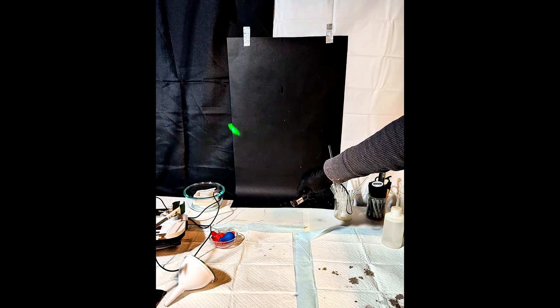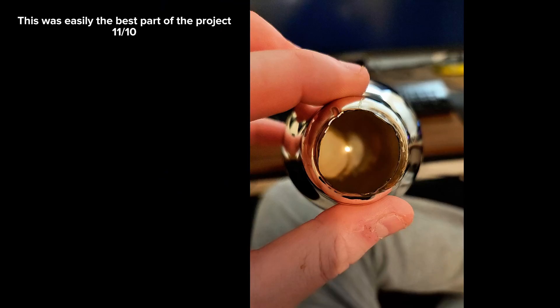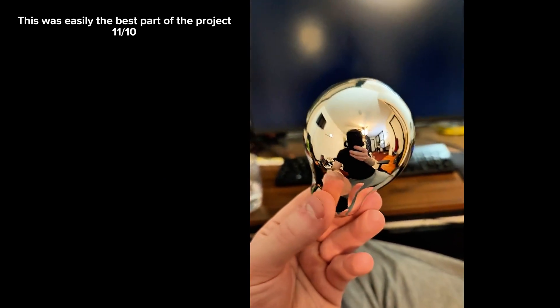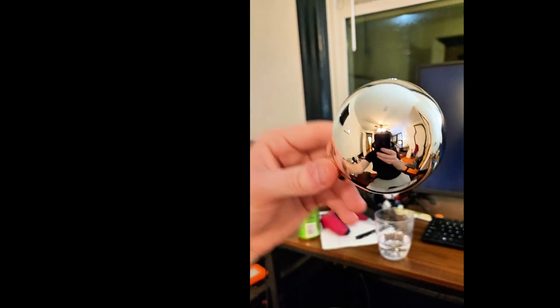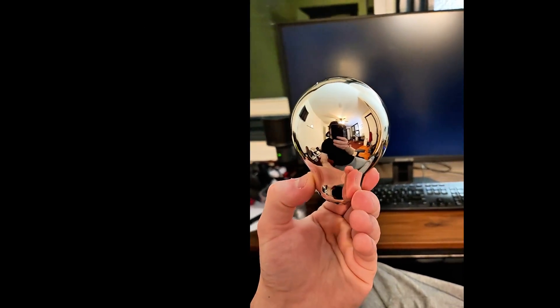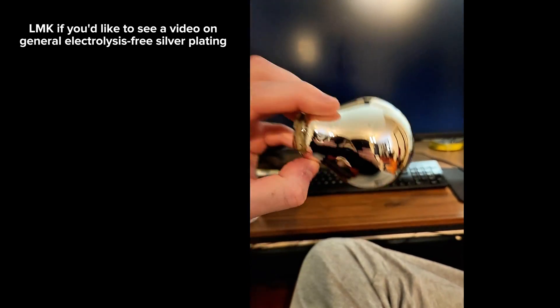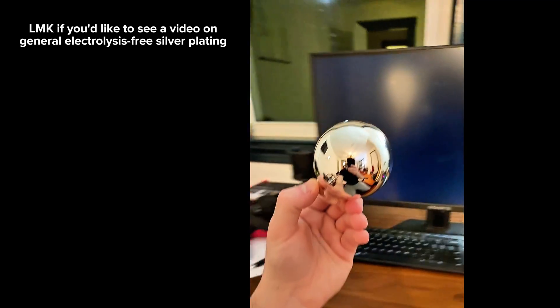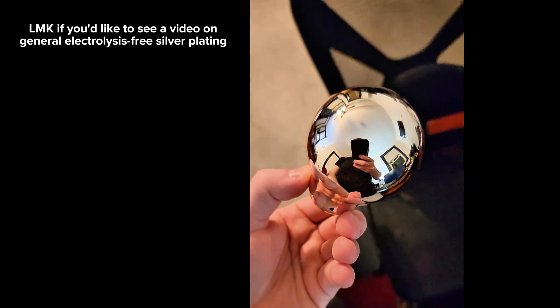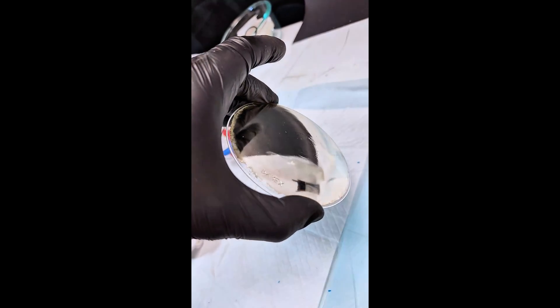The final thing I tried was plating the inside of an old light bulb, which was impractically delicate but the most beautiful thing that came out of this project in my opinion. In any case, that's about all there is to this specific reaction. There is technically a variant to this process that allows silver to be plated on the outer surface rather than the inner surface like I showed here. This other process can also be used to plate a much broader array of materials than just glass. Let me know in the comments if that's something you'd like to see in a future video, and I'll give it my best shot.